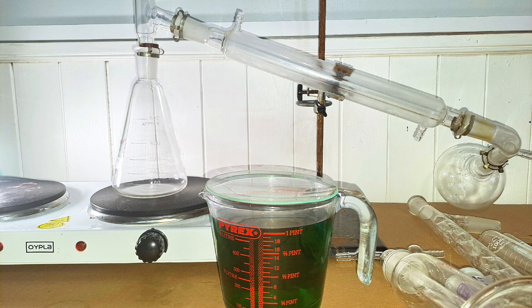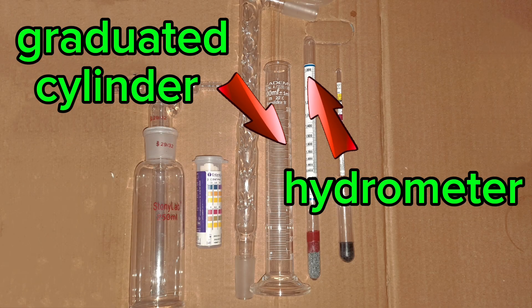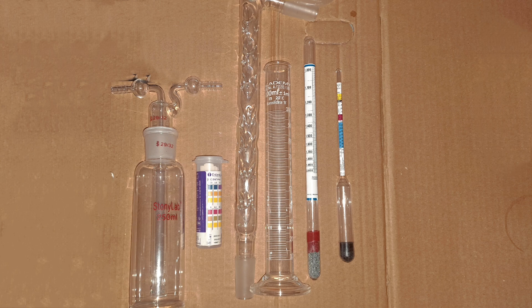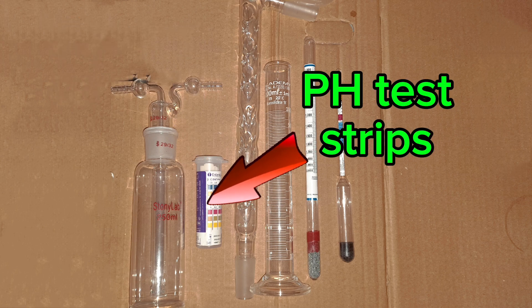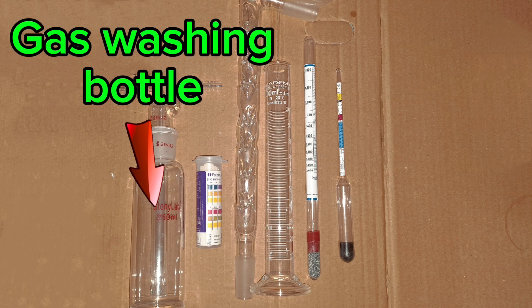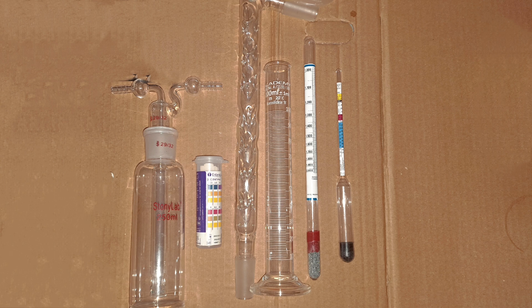For this experiment I will be using a simple distillation set and a hot plate to distill the copper chloride. I'll also be using a graduated cylinder and hydrometer to test the specific gravity of the acid, a vigreux column for the fractional distillation, some pH test strips to test for the presence of acid, and a gas washing bottle to bubble hydrogen chloride through the recovered acid. You could also do this with a glass pipette placed in the graduated cylinder.